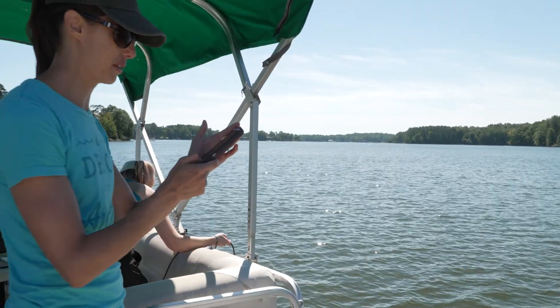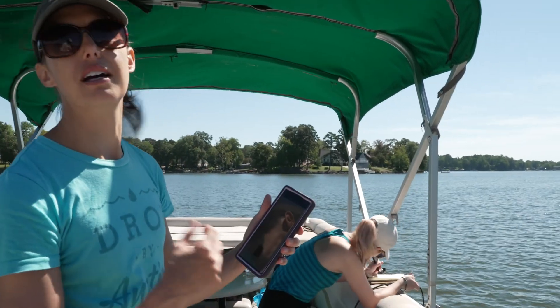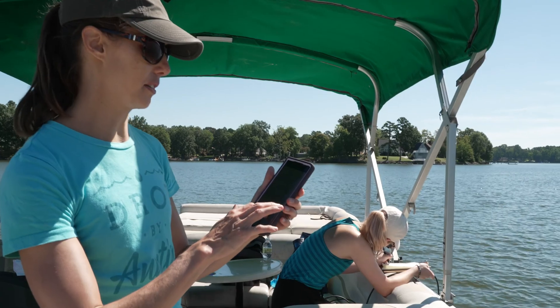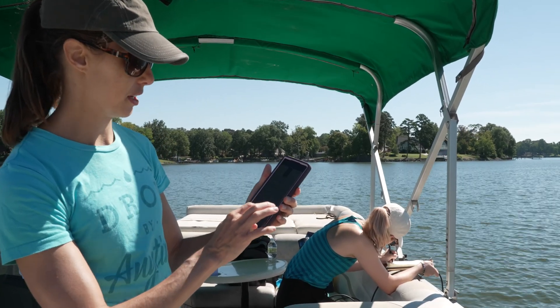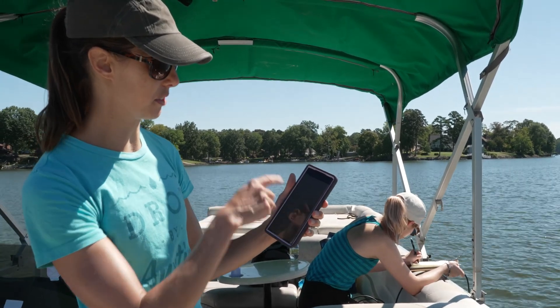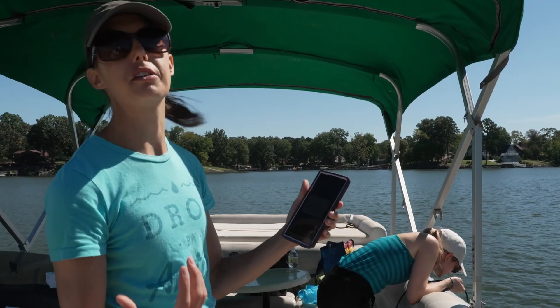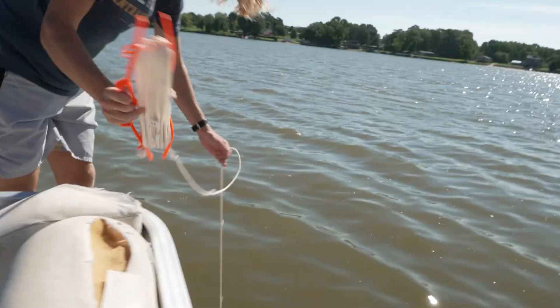Something else we're doing is logging our sampling points on an app that ties into an ArcGIS data portal. We're working with a professor at NCCU who is designing this data portal. I just logged our location and took a photo, and we can later go in and add all our lab analysis and other data. When you hit check and send it in, it automatically shows up on an online ArcMap interface so you can see where we went and collected the data.